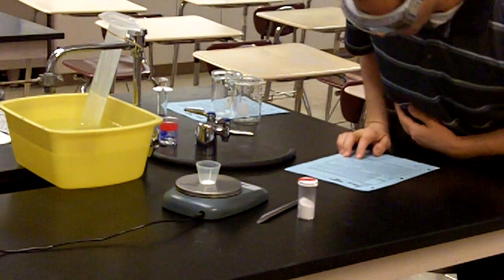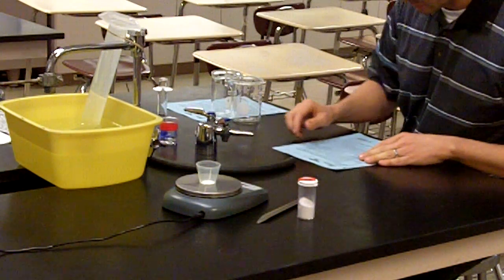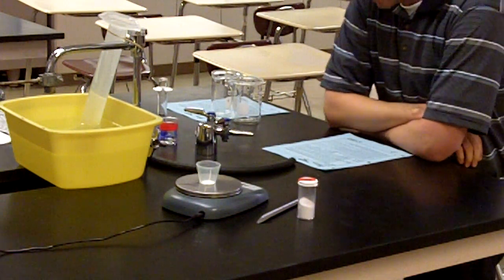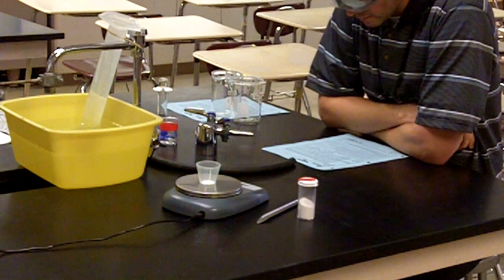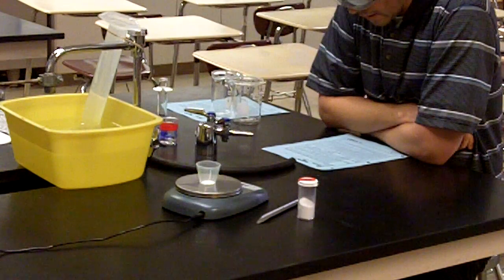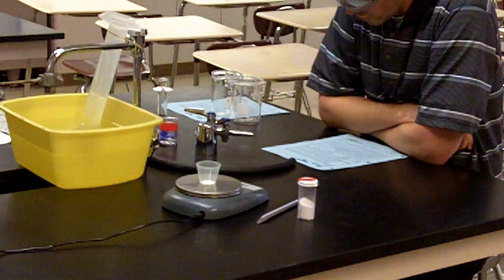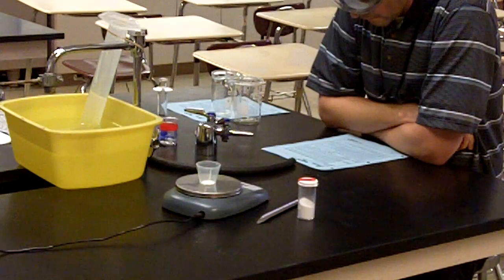The purpose box reads: to observe a reaction between two reactants, sodium bicarbonate and hydrochloric acid, to produce substances that are safe to handle, such as sodium chloride, water, and carbon dioxide gas. The carbon dioxide, CO2, produced is the focus of this lab experiment, and the volume of the gas produced in the reaction will be calculated using the Combined Gas Law and standard values of temperature, pressure, and volume.